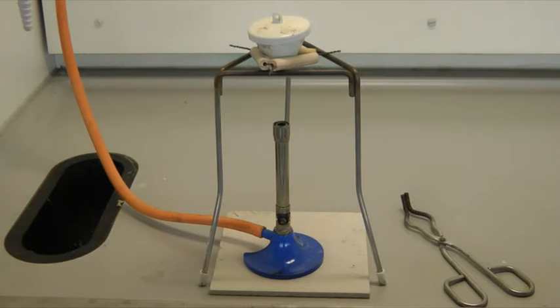At the end of your experiment, the Bunsen burner should be turned off and the crucible allowed to cool. This will take some time. Your teacher will then give you guidance on what to do next.